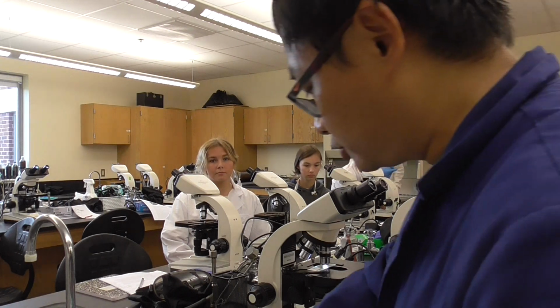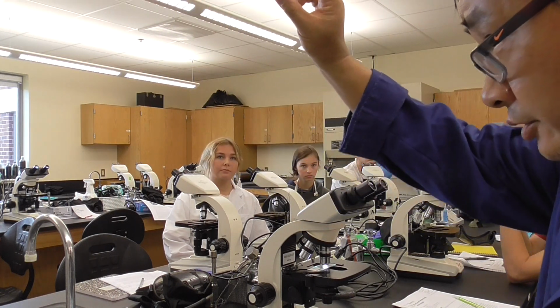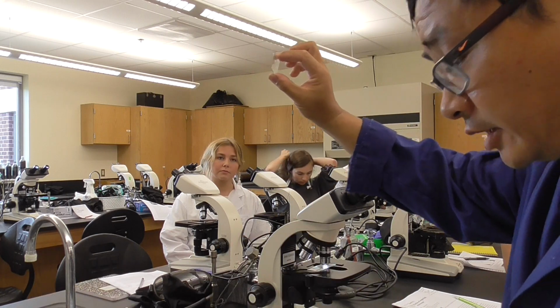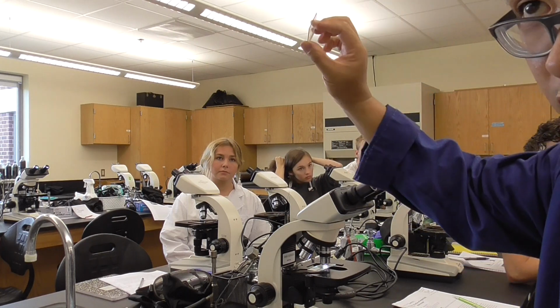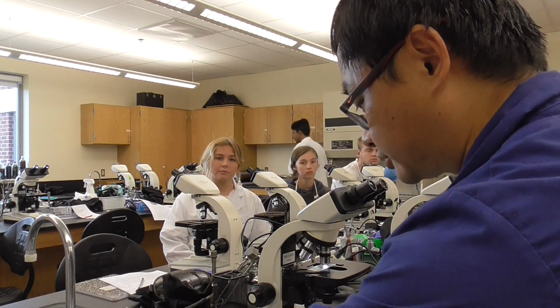When you finish this, you also get another slide. This is the budding yeast, Saccharomyces cerevisiae, which is used for beer brewing. We will talk about it a little later when we move to fermentation, but you get to know the difference between these two things. This is a yeast, a eukaryote. That is a prokaryote, a bacteria.